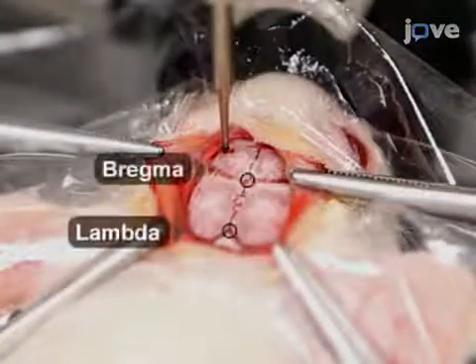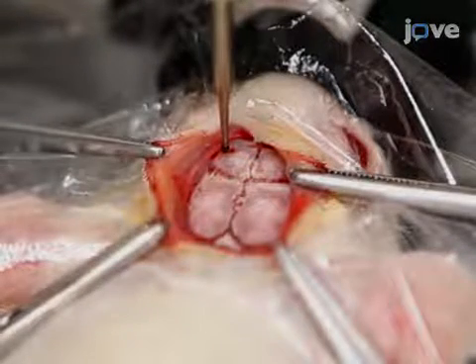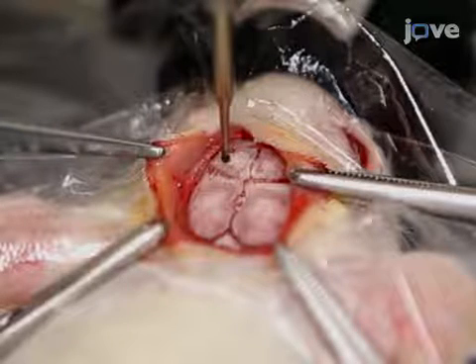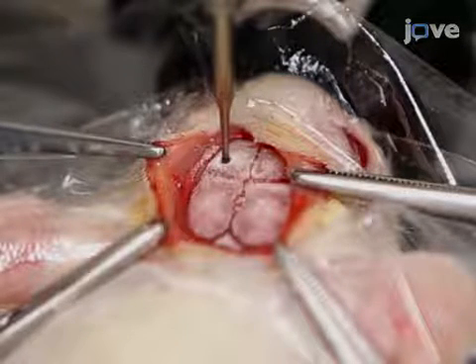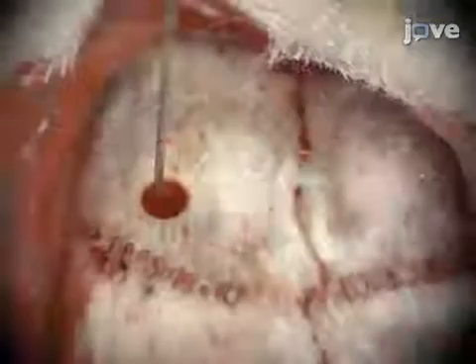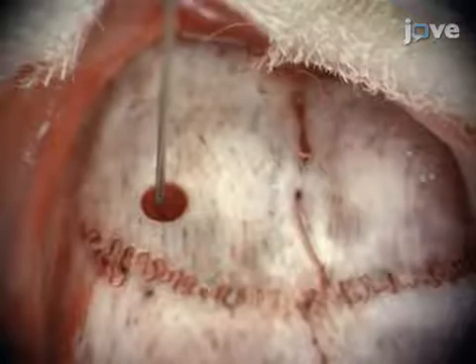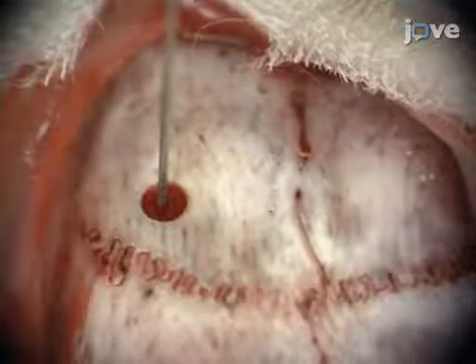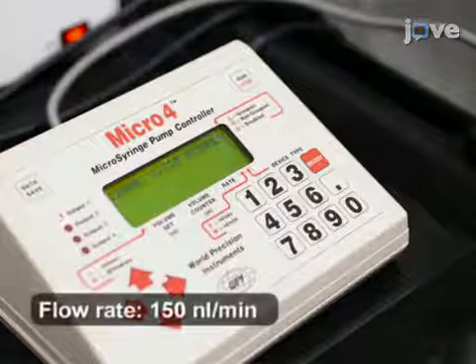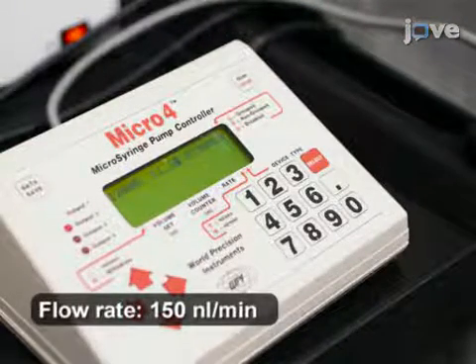Identify lambda and bregma locations on the skull, then position the drill bit over the region of interest, or ROI. Drill a small craniotomy over the ROI with a dental drill, taking care not to puncture the brain. Slowly insert a needle attached to the microliter syringe through the craniotomy into the ROI in the brain. Then, use a microsyringe pump controller to inject 2 microliters of the vector solution into the ROI.